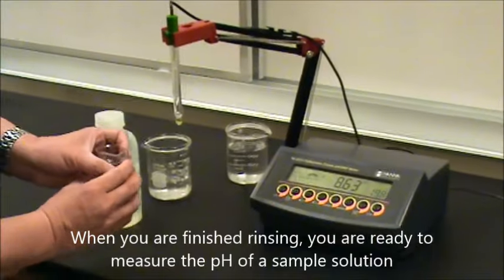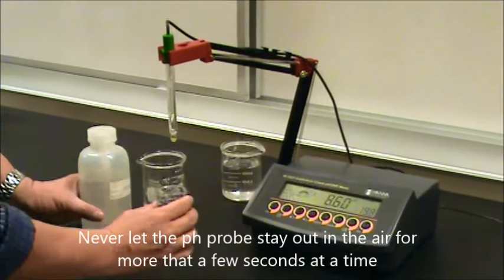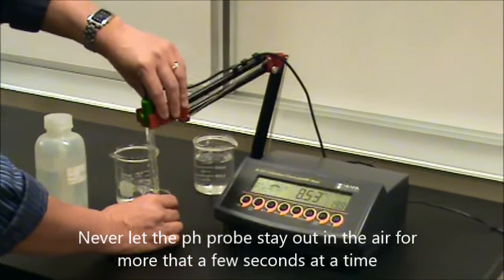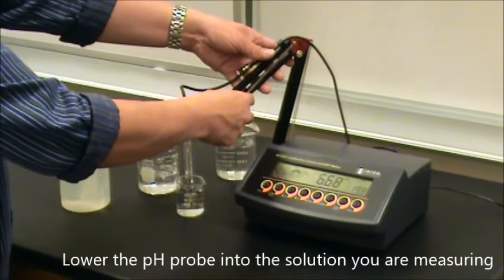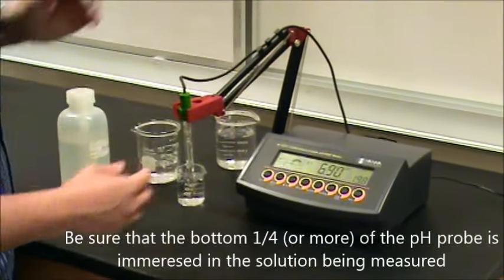When you're ready to take a measurement, go ahead and take the solution that you're going to measure. Again, not letting the probe stay out too long, immediately lower the arm into the solution. You'll notice that the meter will start to change.